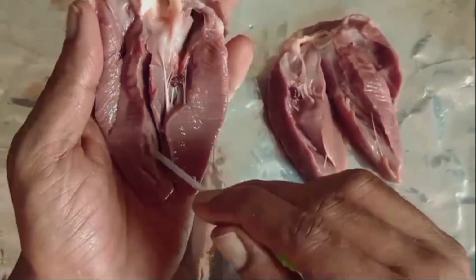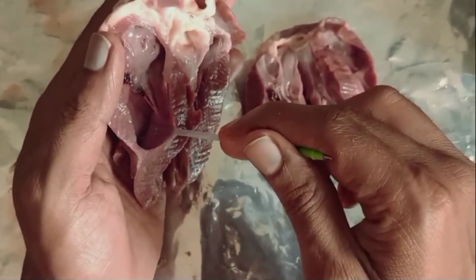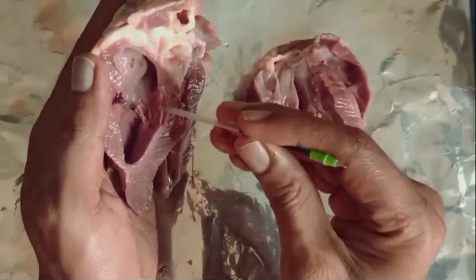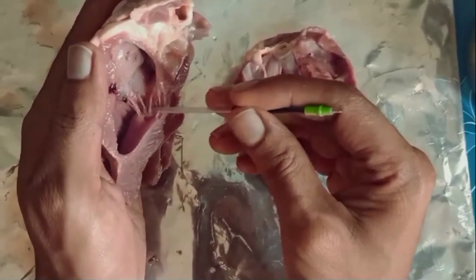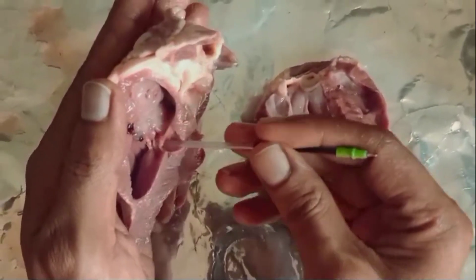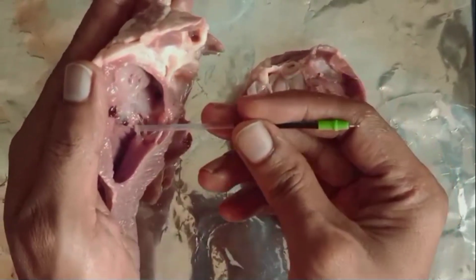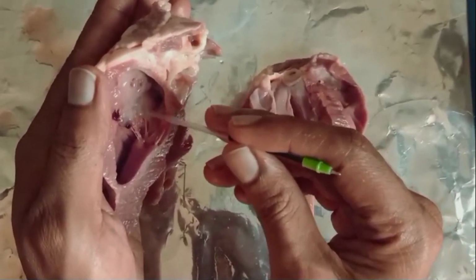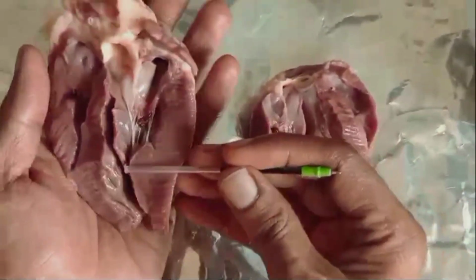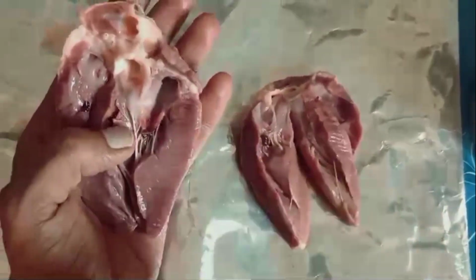ventricles. In the same way here also, from upper chambers to lower chambers, you can see this one, the lower chambers. This is the blood vessel. One more cuspid valve, we know that this is the tricuspid valve. Here also we can find the chordae tendineae muscles. These chordae tendineae muscles protect the closing and opening of the tricuspid valve, and here the left side is protected by the bicuspid valve.